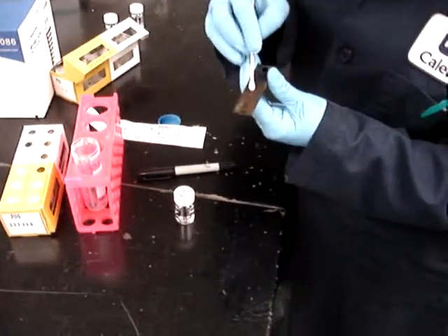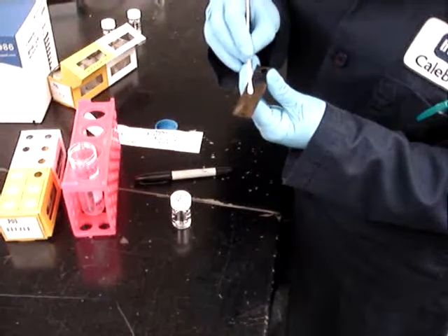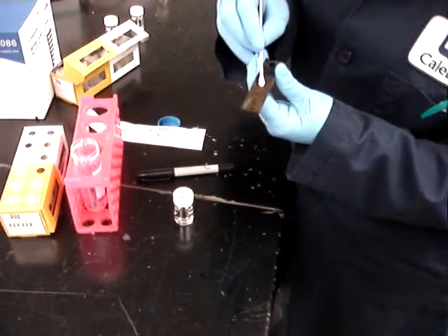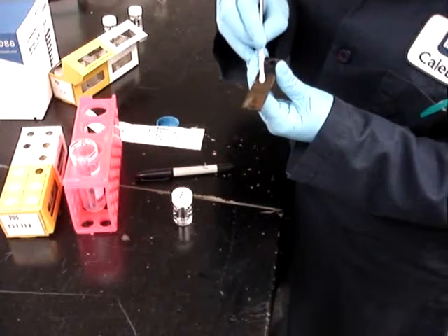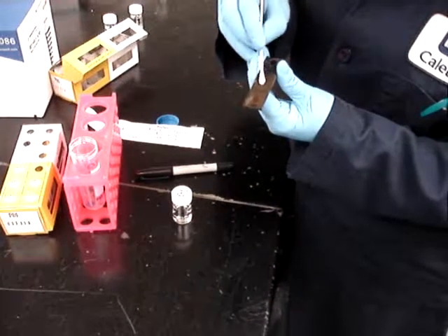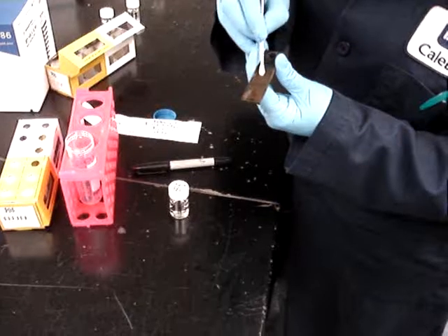The cotton bit on the end of the wooden stick is about one centimeter long, and an area of the coupon that's one centimeter squared is the area to be collected.